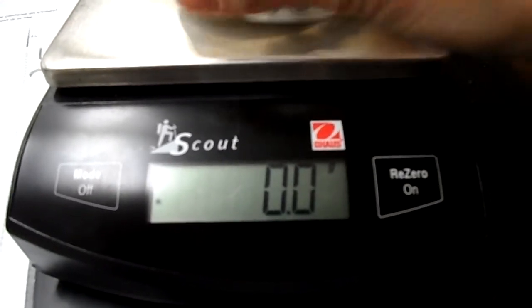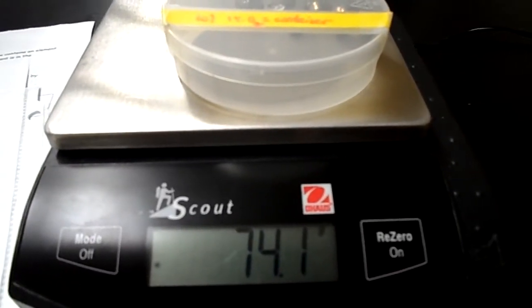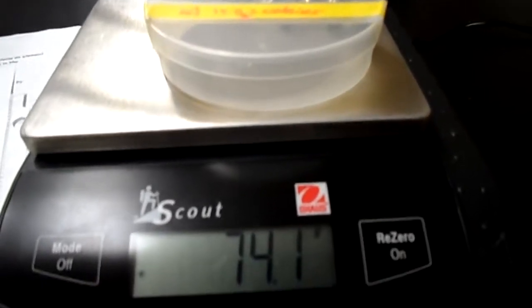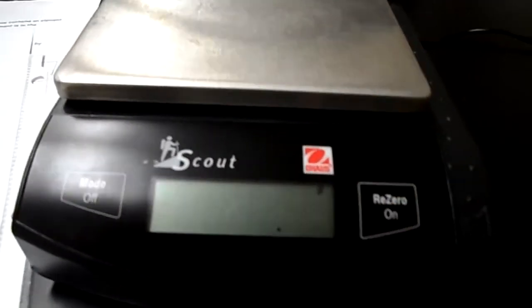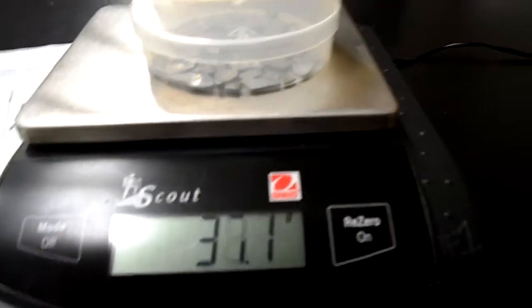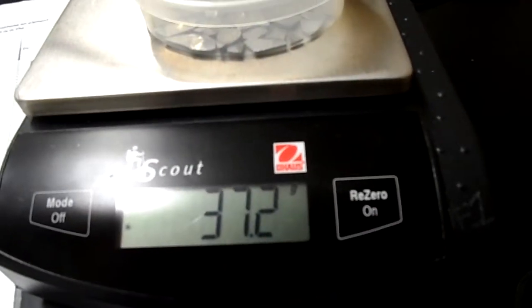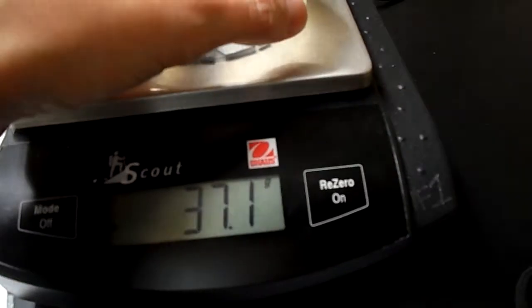All right, element 10. So check that out. The container is 15.0 grams. And you can see on the scale, it's reading 74.1 grams. That's container plus element. So what element is this? Element 11. The container is reading 13.9 grams. Together, it weighs 37.1 grams. And there is a molar conversion on here, so that mole is reading 0.438 moles. So you will have to do a molar conversion to figure out what element this is.